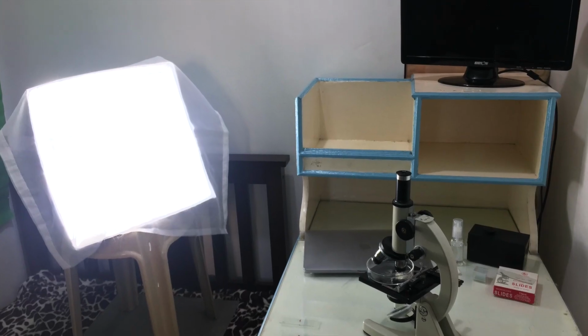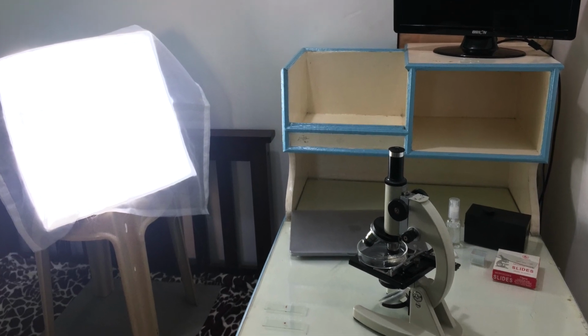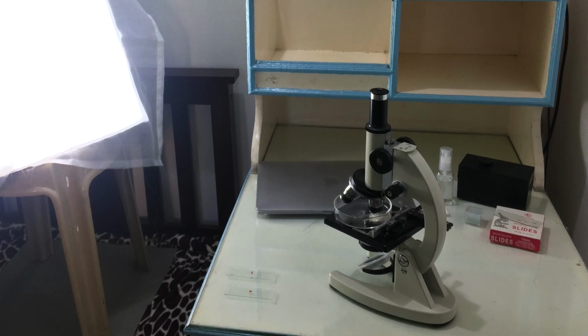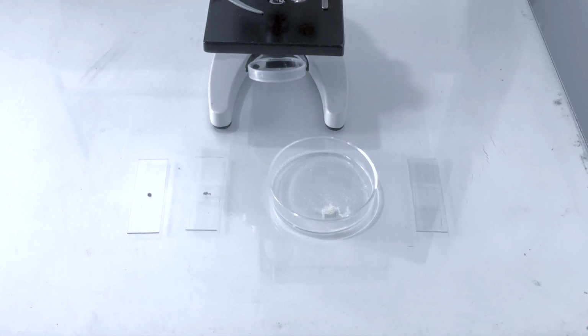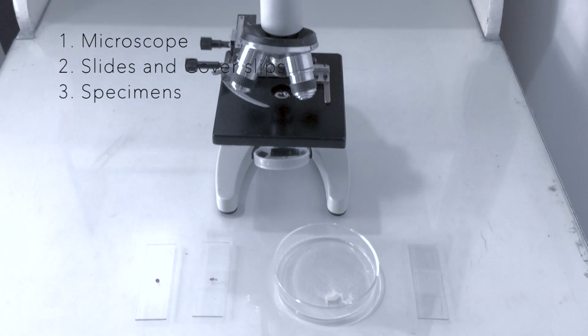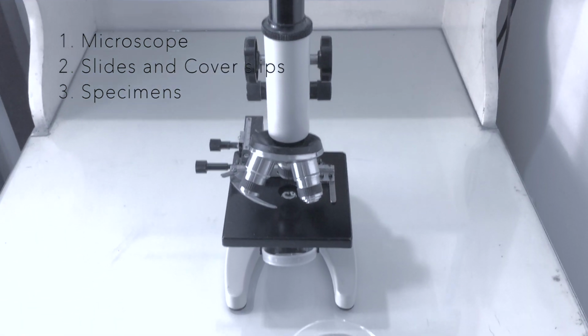You can see that this is not the place I filmed our last video, and not much chemistry equipment is involved since all of those are in our other house that I can't visit due to the COVID-19 pandemic. But anyway, what's important is that we have the microscope and a few slides with all our specimen.